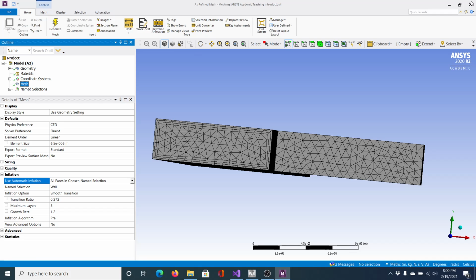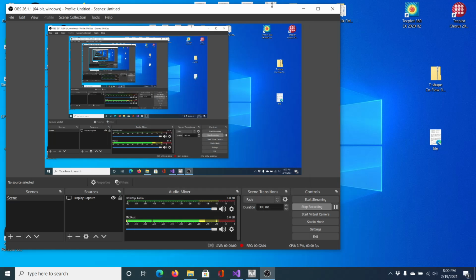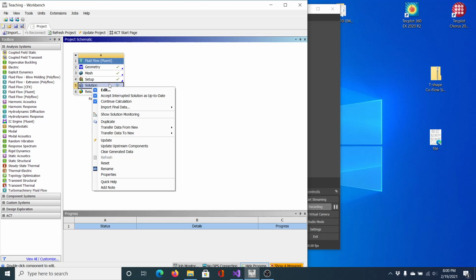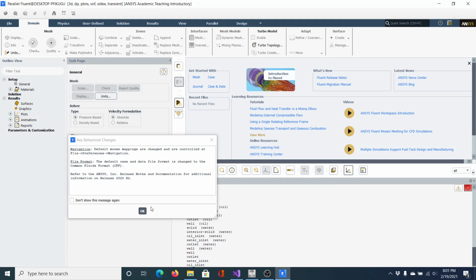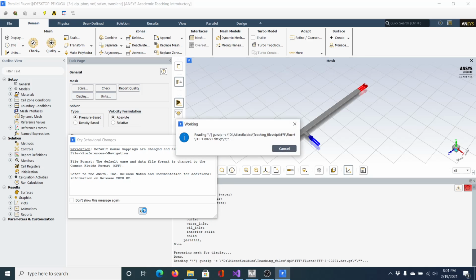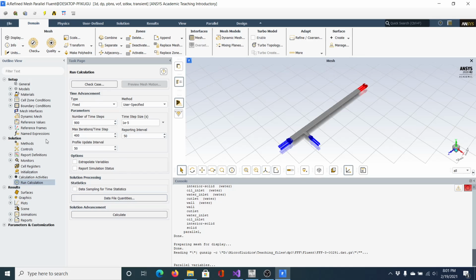The other way to do it, and I'm going to go ahead and close this out, the other way, the correct way, I should say, is to change some of the relaxation factors, and I'm going to show you how to do that in a second. Some of these things might look a little different, and I'll explain why in a moment.